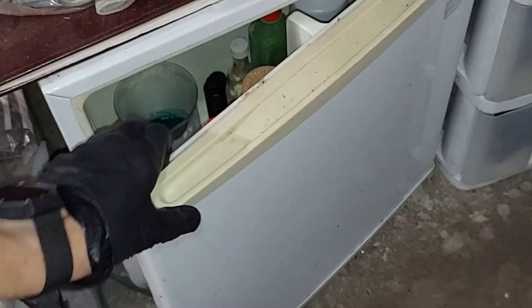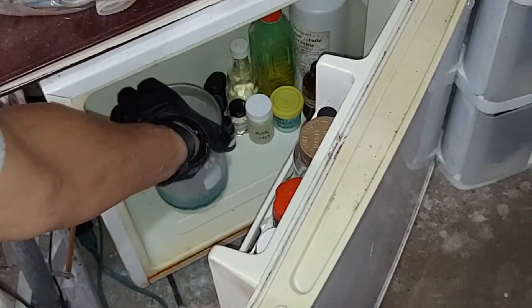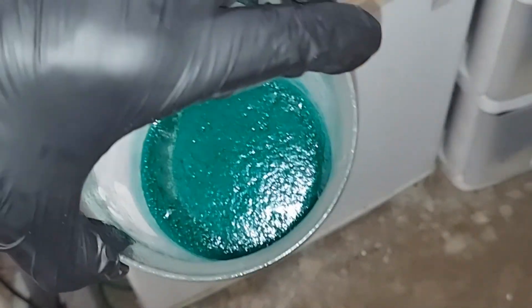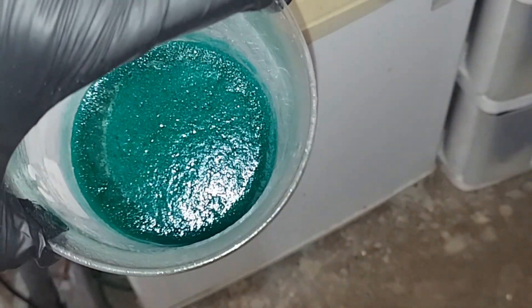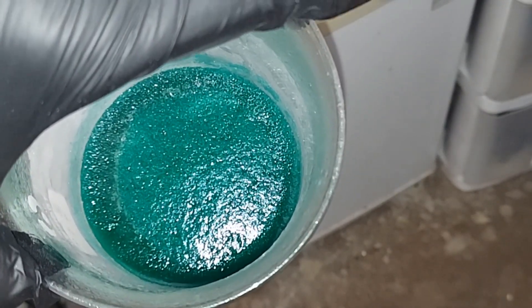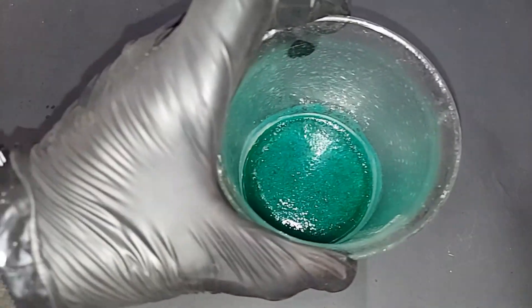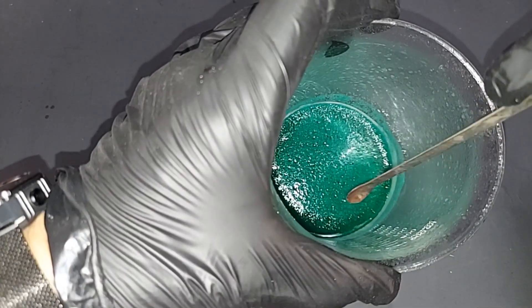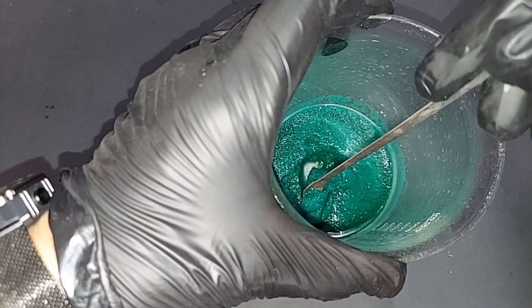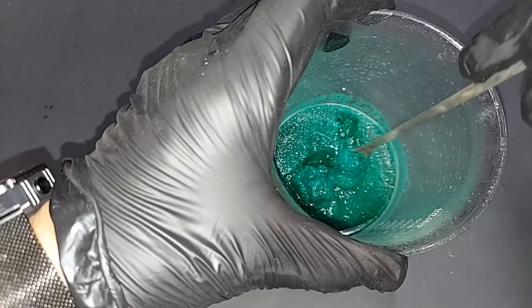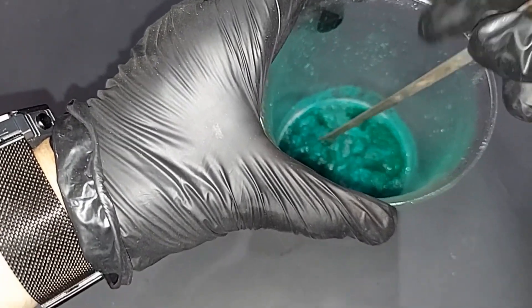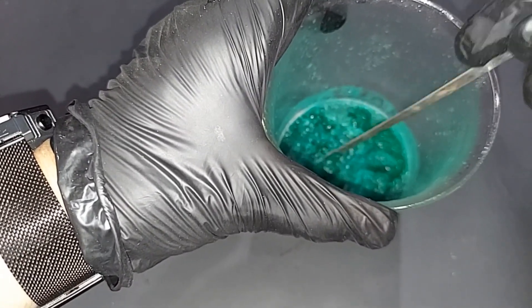It's been around four hours, so let's take a peek at this here. It's really frosted - it's quite humid here where I'm at. Look at that! Now that fridge gets really cold so some of that might be actually frozen, but I'm sure that there are crystals in there. There's a little bit of liquid around the edge as you can see, but oh wow yeah, it's kind of slushy. Looks like there's actually a chunk in there that froze, but most of this is definitely nickel sulfate hexahydrate. Awesome, turned out really great. Let's go ahead and filter this. I might let it warm up just a touch more so I can break down all these pieces.